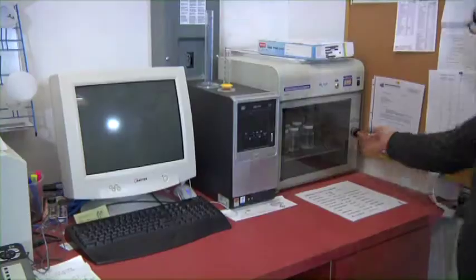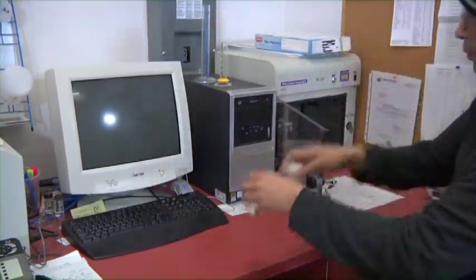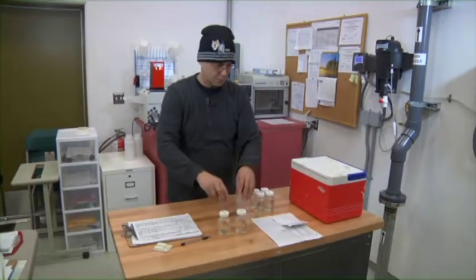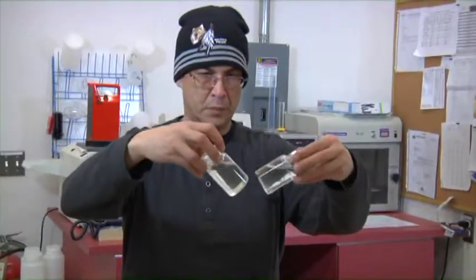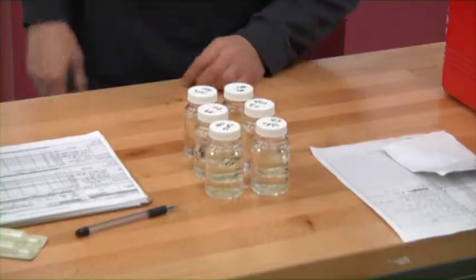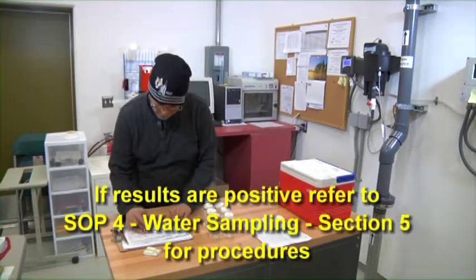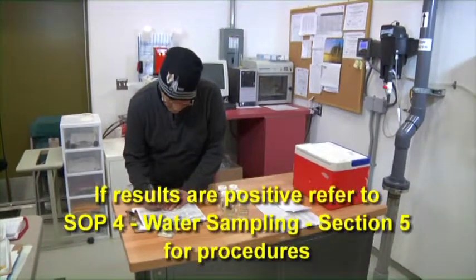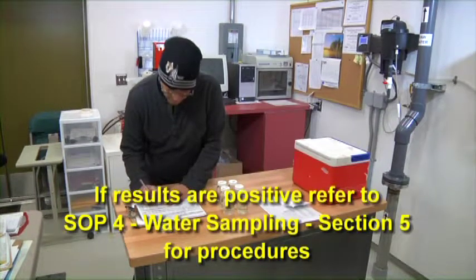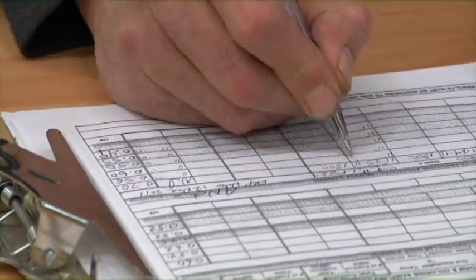After 24 hours has passed, remove the sample bottles from the incubator and visually check for any colour change in the sample water. If the water is colourless, the sample is negative for bacterial content. If the water is yellow in colour, it is positive for bacterial content. If this occurs, please refer to SOP 4, Water Sampling Section 5, for procedures for dealing with positive results. Record all the results on the sampling record sheet.